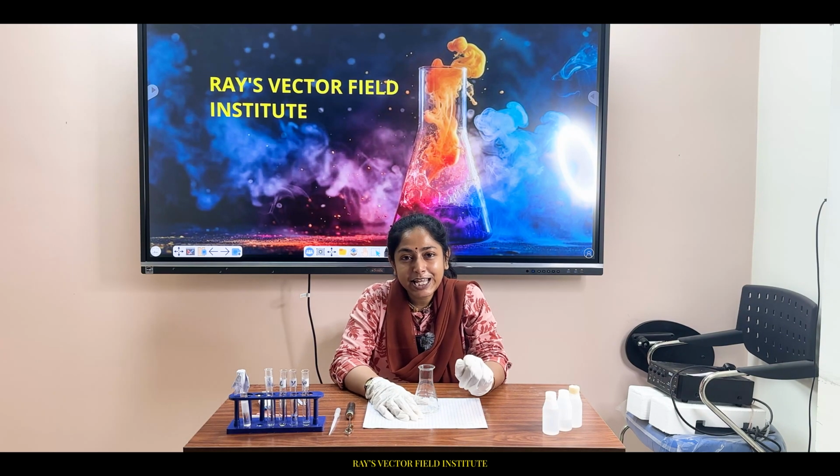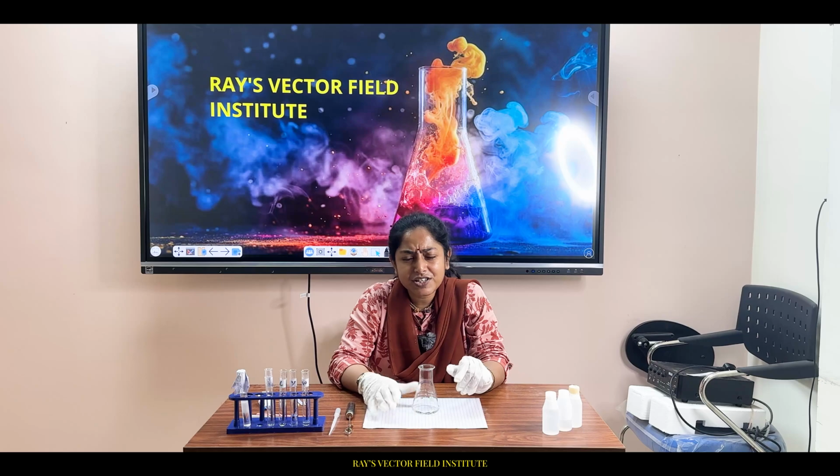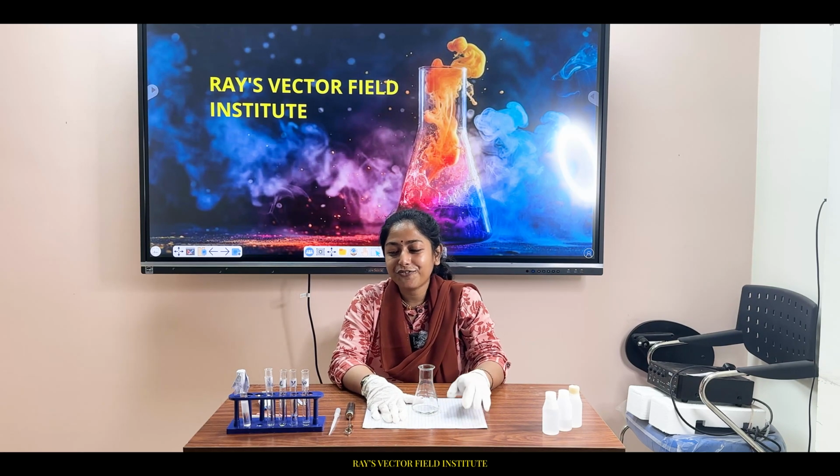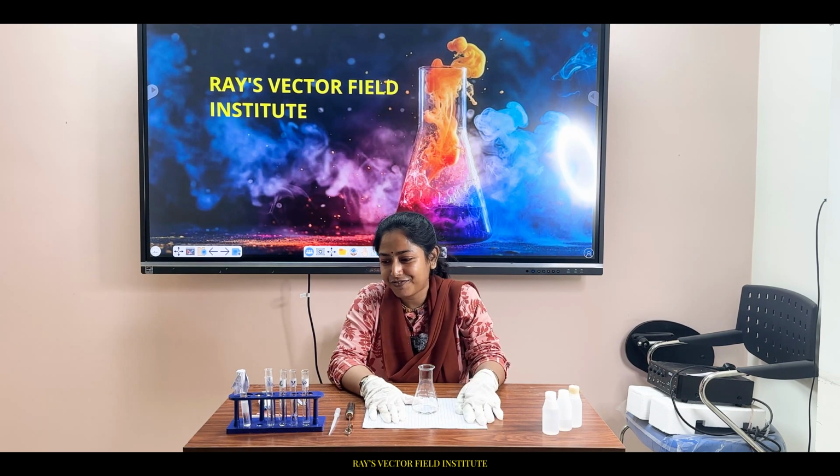The name of the game, specifically the experiment, is acid base titration. In your words, very commonly it is said as neutralization reaction. For this experiment, the chemicals that I have taken you will also use in your higher classes.